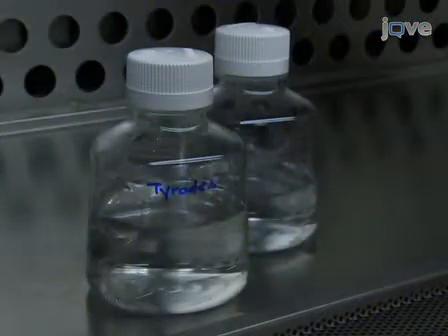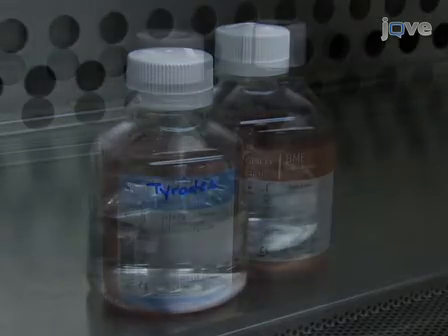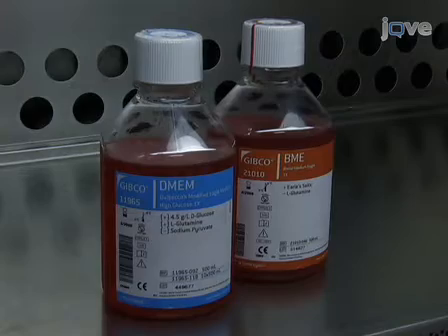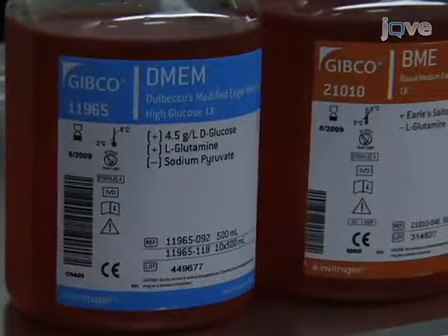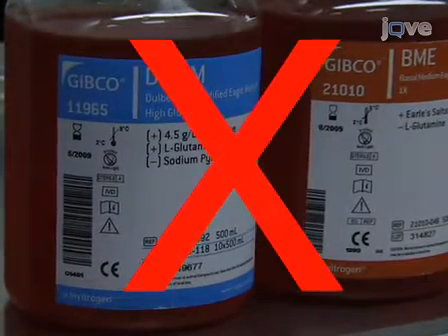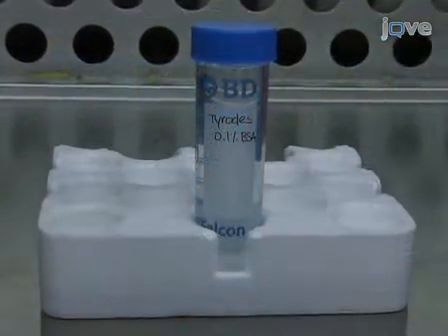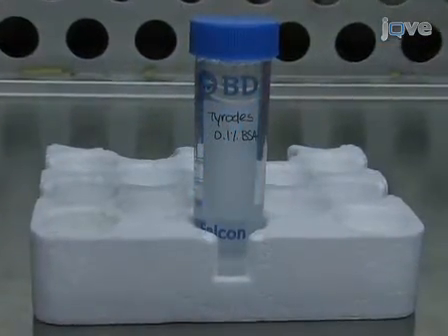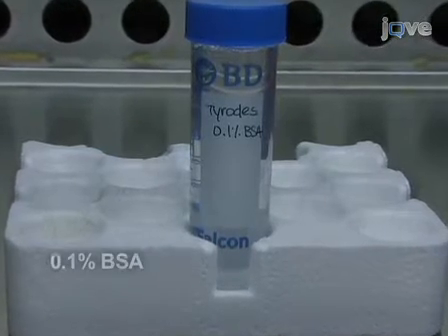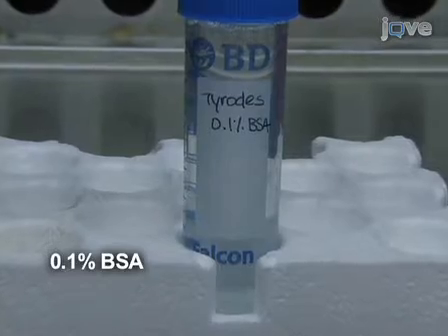A variety of physiological solutions, including cell culture media, can be used for calcium imaging experiments. However, make sure that the solutions are free of phenol red, which greatly increases the fluorescent background. For cortical neurons, we use Tyrode solution, which mimics cerebrospinal fluid, and we supplement it with 0.1% bovine serum albumin.